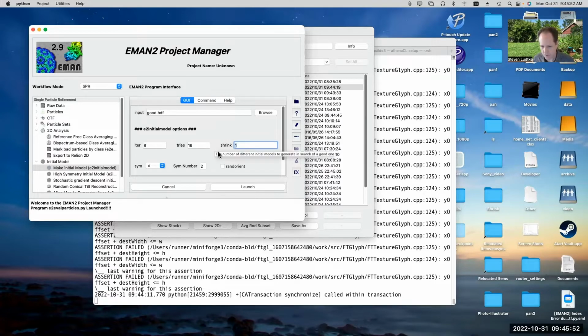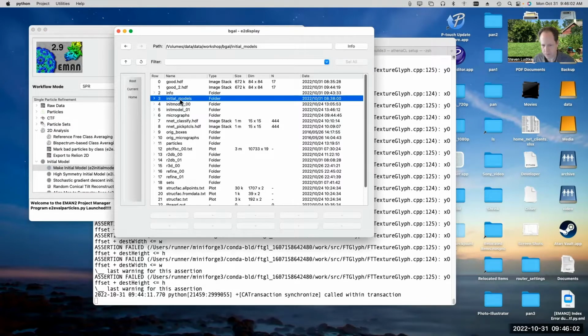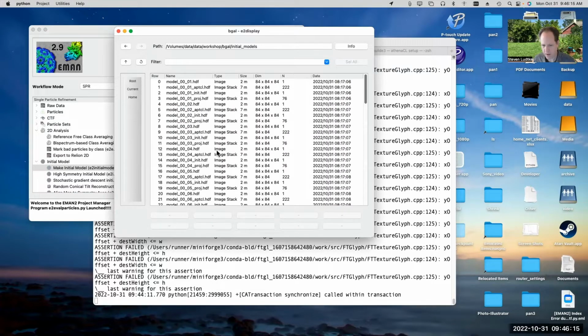Anyway, so you can just set up your options, and when you're done, you should see that there's a folder called Initial Models. These other folders, init model 00 and 01, are using the stochastic gradient descent. We'll talk about those in a minute. But you'll start with this initial models folder, and if we look inside there, you'll see a bunch of numbered files of several different types.